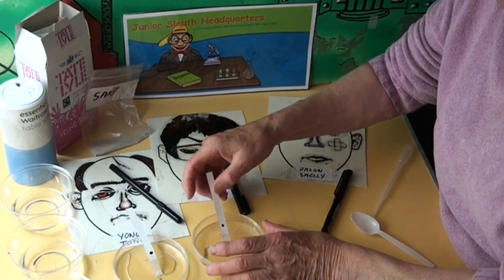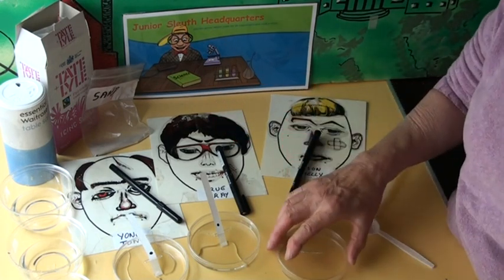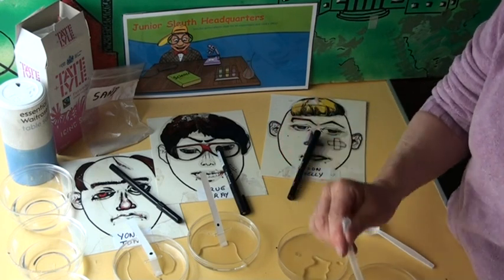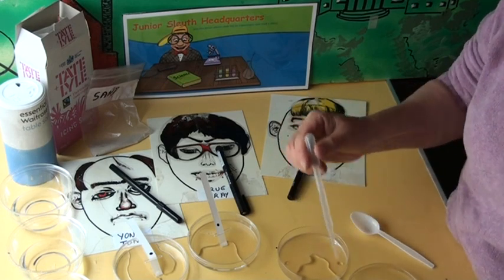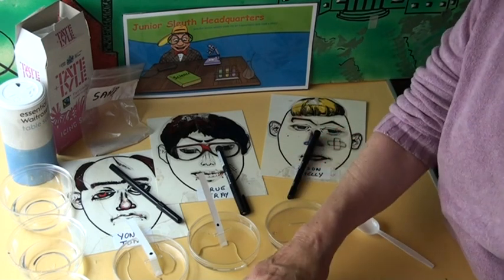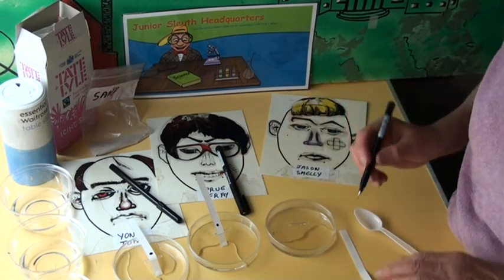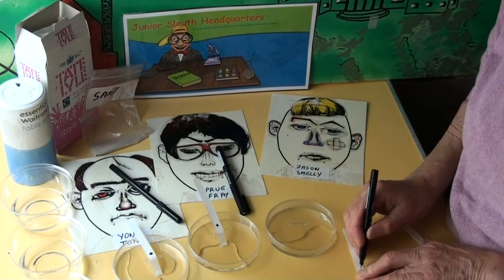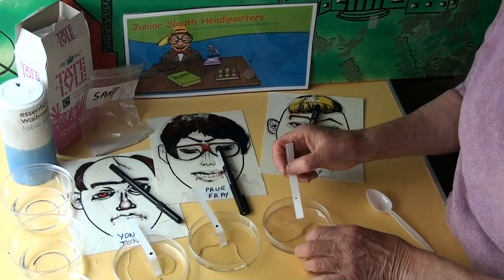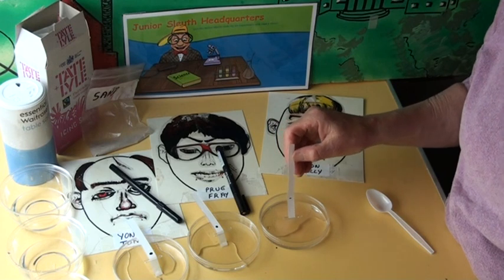The water slowly climbs up the paper and it goes through the dot. The last one we do is Jason Smelly's pen, the very same way — three squirts of water. We lay that aside now. And the last strip of paper gets Jason Smelly's pen. Two fingers from the bottom, a big inky dot. Put the lid on, and put this one in the water too. Put that in the water.